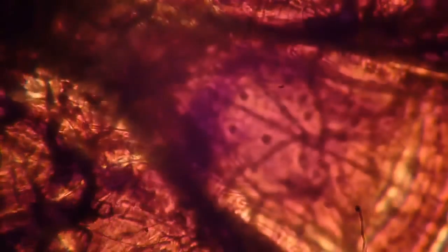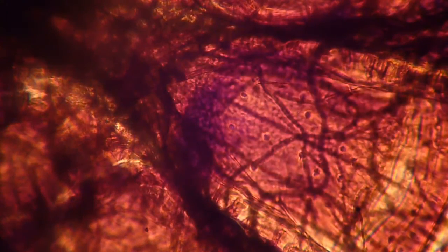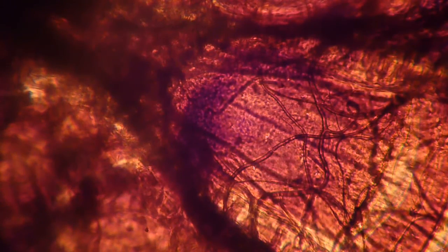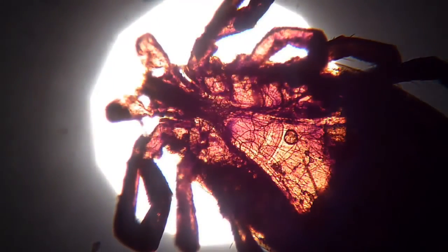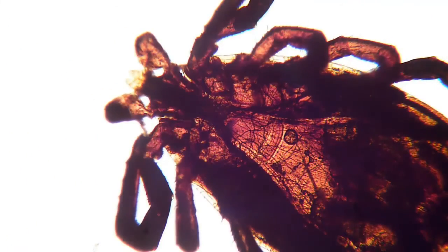I am now going to switch over to dark field. I'm going to go down to lower magnification. You have to exchange, take off the filter, insert, take off the condenser, insert the filter. Now let's see if this works.